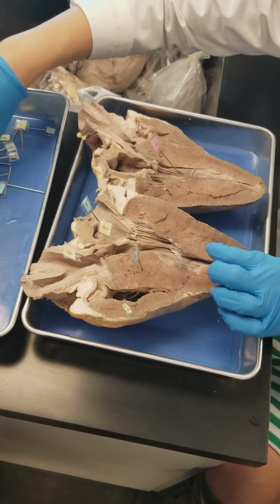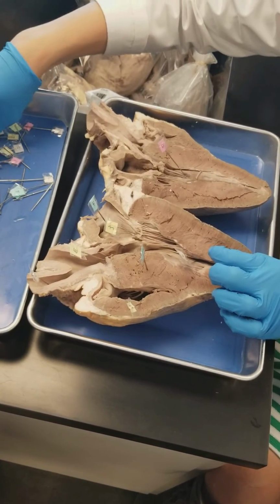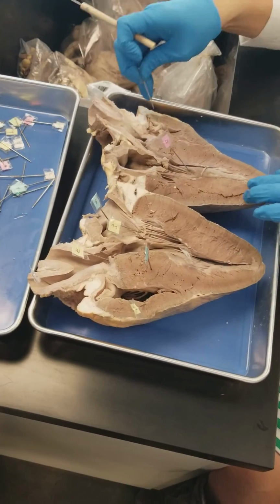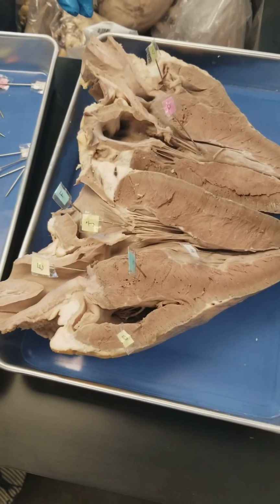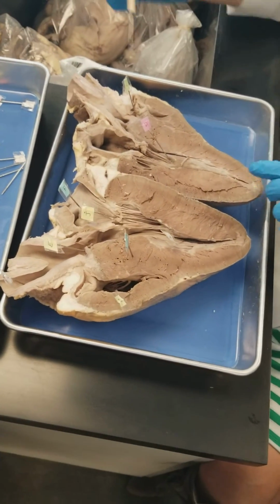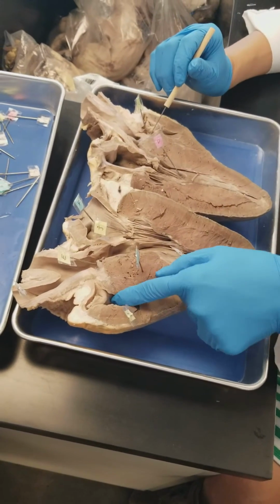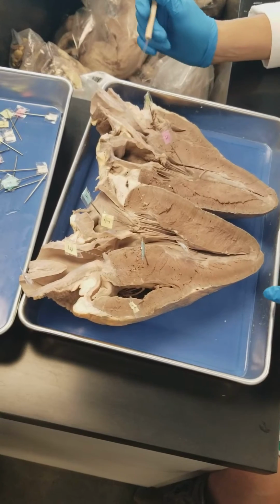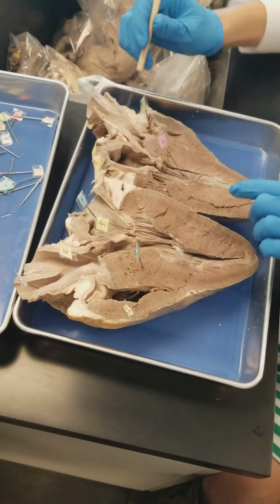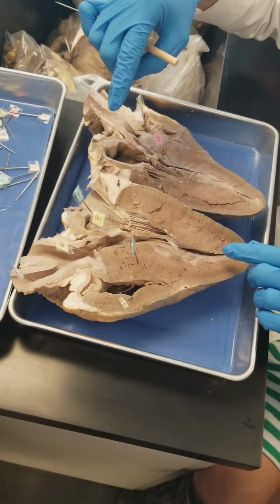Okay, so I'm going to leave this in the refrigerator just like this, since we still have our fridge. And so like that you guys can, so this would be the right atrium. I'm not going to label the valve on here because there's just not enough of it. It's too squished, but that's the right atrium. So where's the left atrium? Left atrium is this one. Also, we should do G, H, and even I.